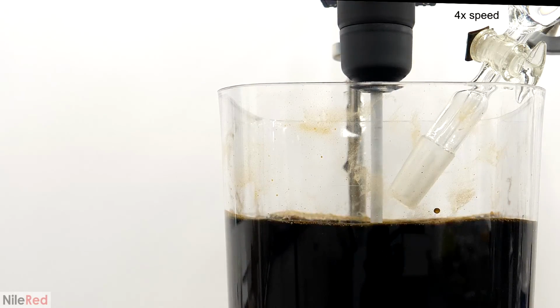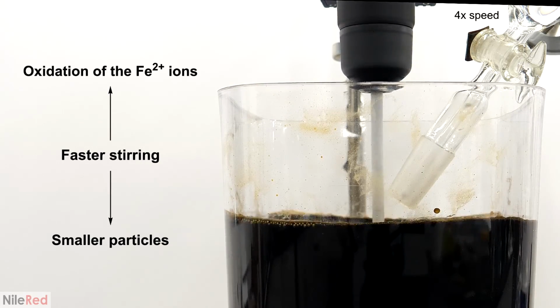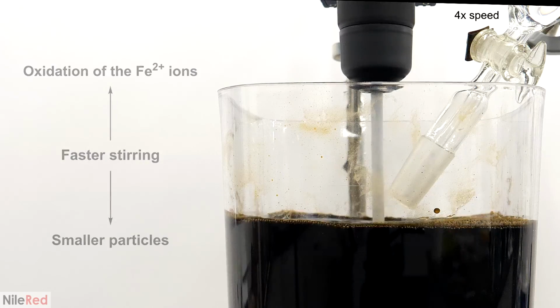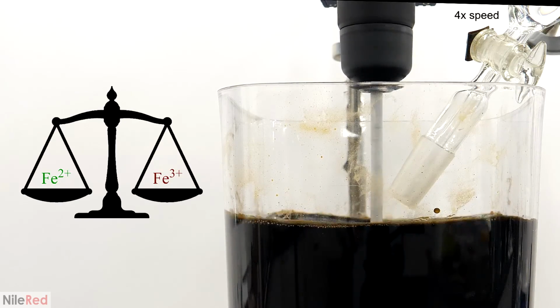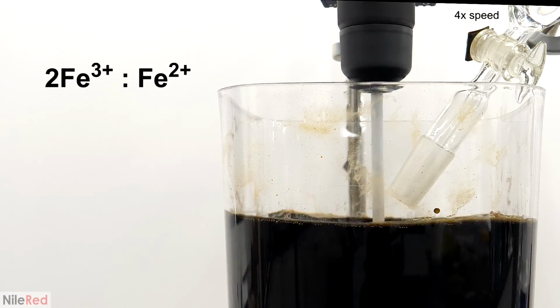In general, I wanted to stir it as fast as I possibly could, because as the stir rate increases, particle size tends to decrease. However, the faster I stirred it, the more air got mixed into the reaction, which caused more iron 2 to get oxidized to iron 3. This altered the ratio of iron 3 to iron 2, and if this wasn't accounted for, the quality of the magnetite would be affected. For magnetite, the perfect ratio between iron 3 and iron 2 is 2:1.